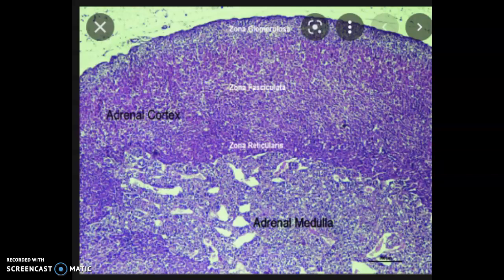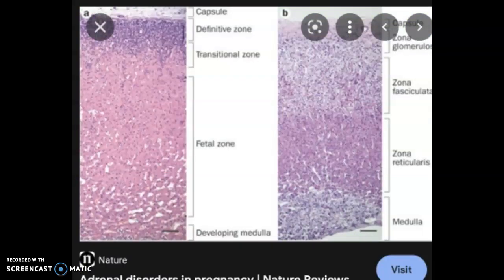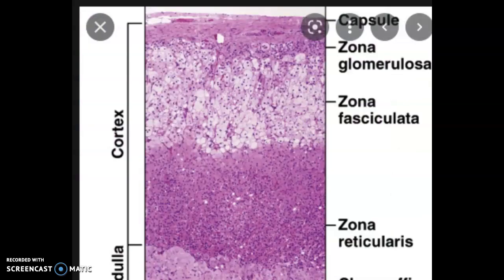So this slide I would not show. I swear that's the slide out of my book, by the way. I did not give you a slide like this because I cannot tell the difference between that zone and that zone. So I give you a nice picture like this that has definite clarity between the zones.